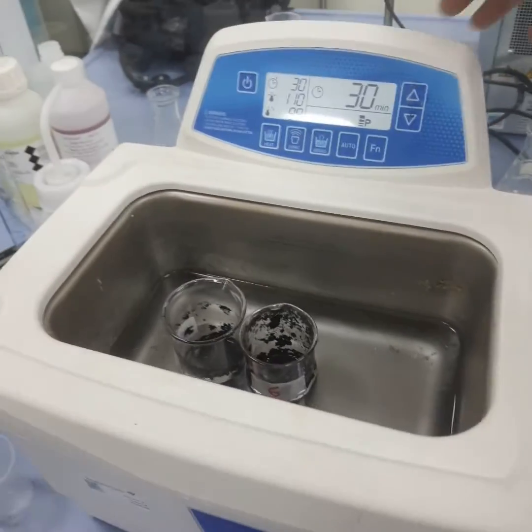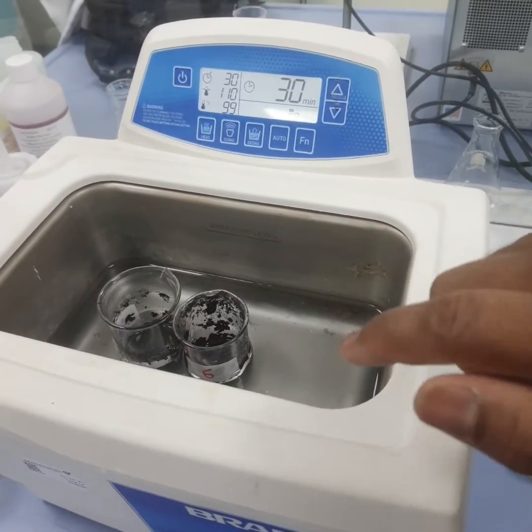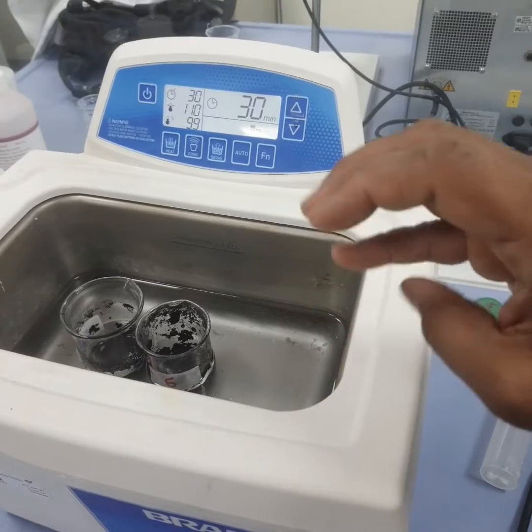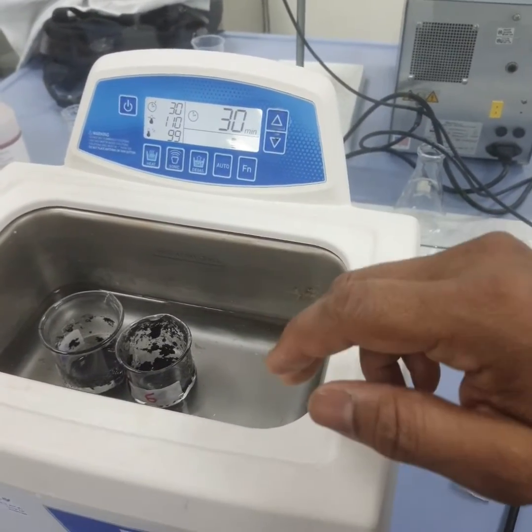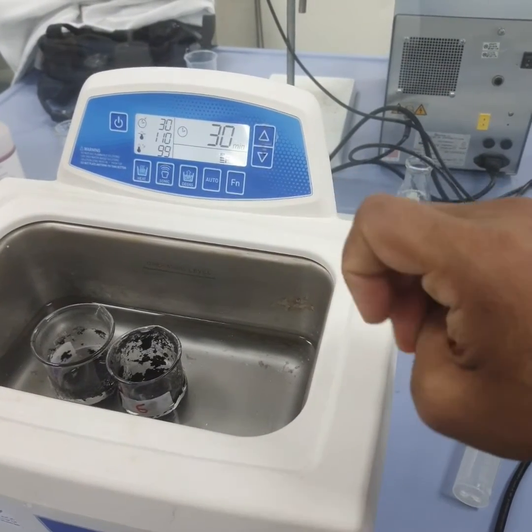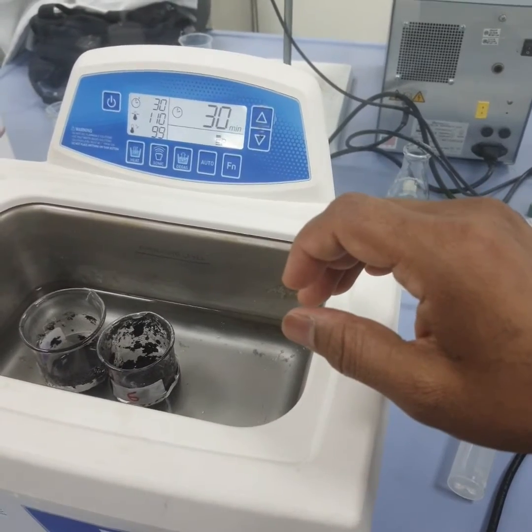Okay, so now what we are going to do, after you prepared the assortment, the mixtures. The solvent was DMF, and you added activated carbon at different ratios, and what did you add? Polymer. Yes, PCL. What is PCL? Can you check it, please?